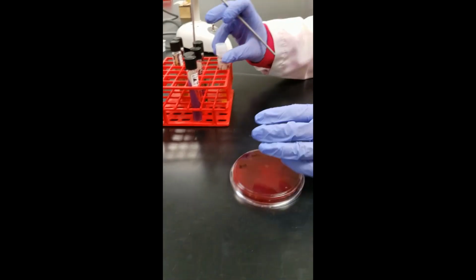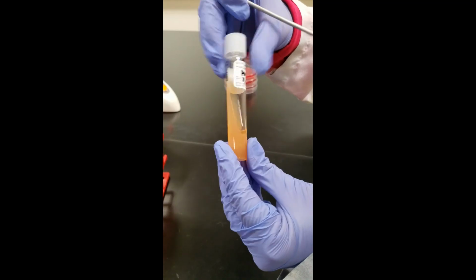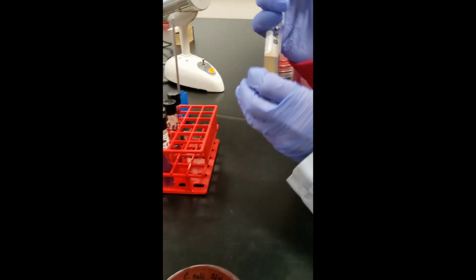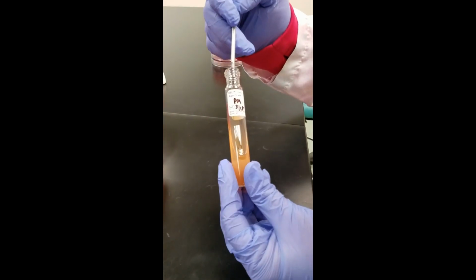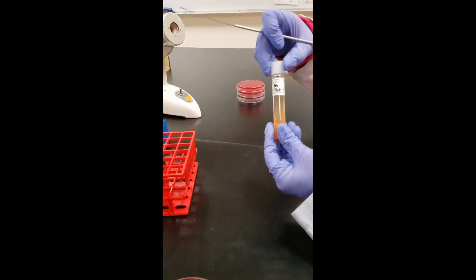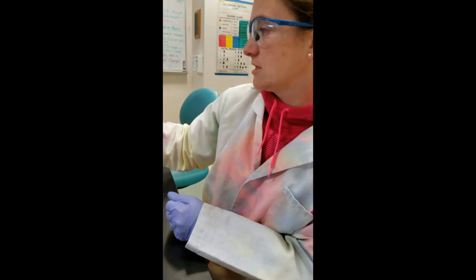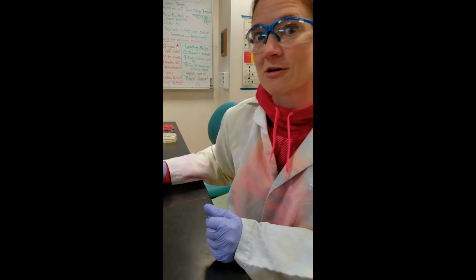Cool off. And then our very last tube that we're going to set up is called the urea agar. It kind of has a peach color to it to start off with. Just loosening my cap to get it ready. I'm going to pick up some more bacteria from another colony. And this is also just a zigzag on the slant, starting at the bottom and just zigzagging up to the top. And this tube also gets a loose cap. The only cap that we have as a tight cap is that first tube, the Lysine iron agar. Incinerate my loop, and we're done inoculating. Then we just have to incubate and wait 24 hours.